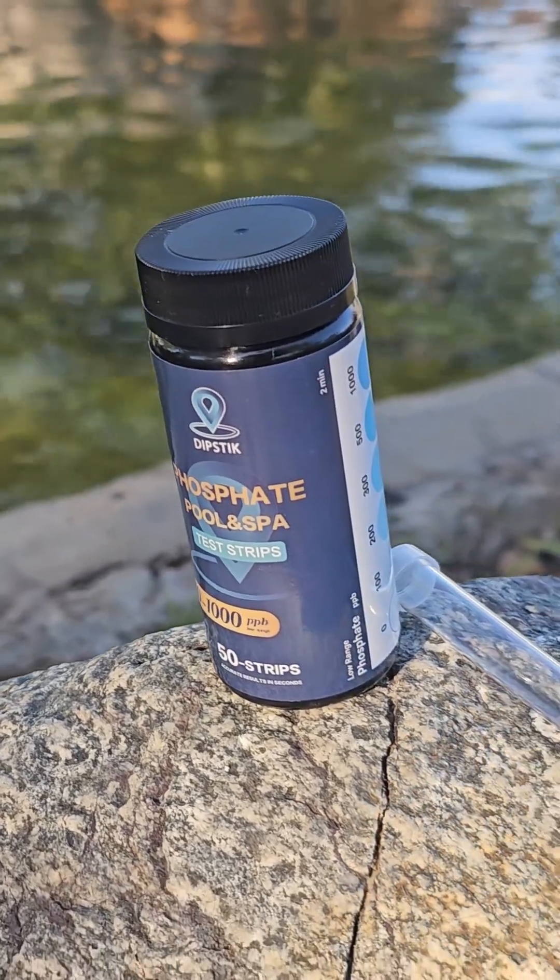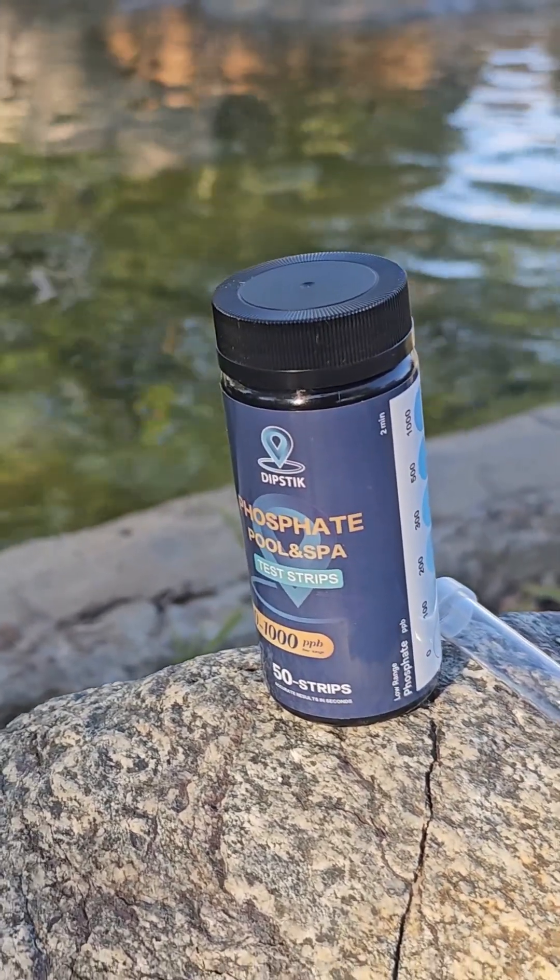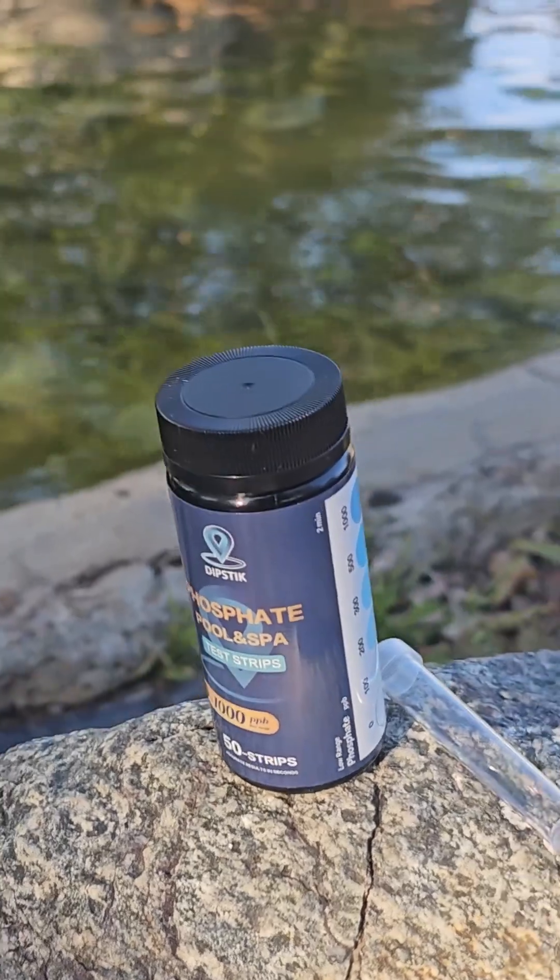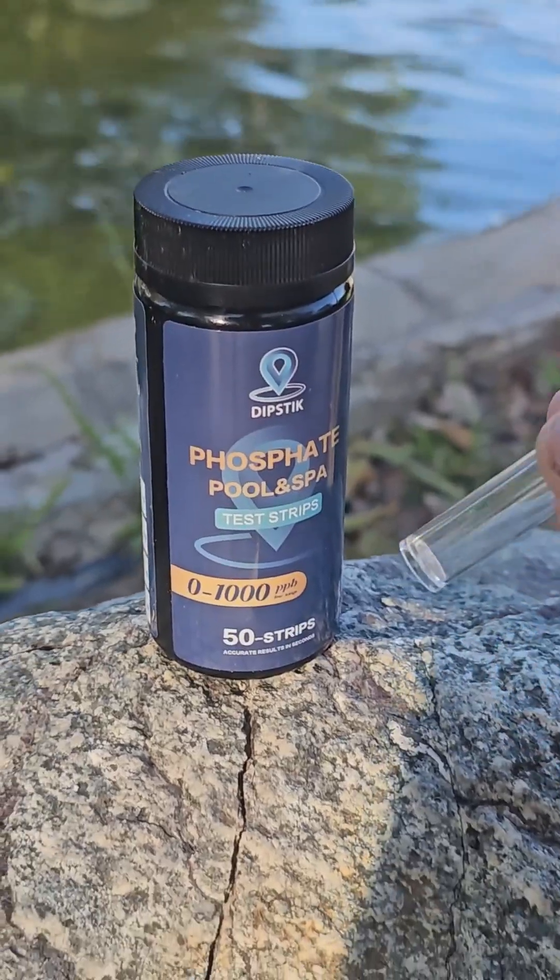Today we're going to put it to use and I'm going to show you how it works. They give you a container here, and this is if you want to grab some water.